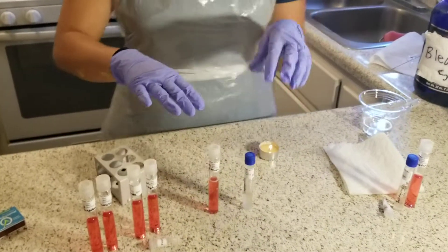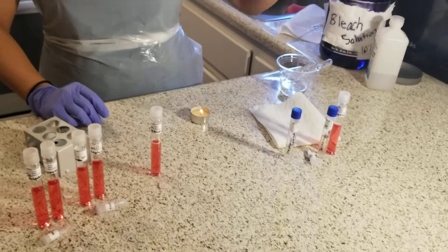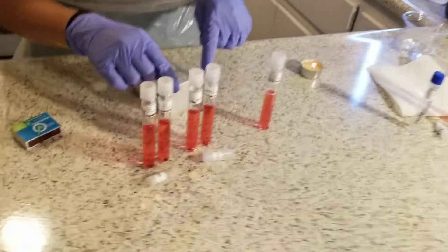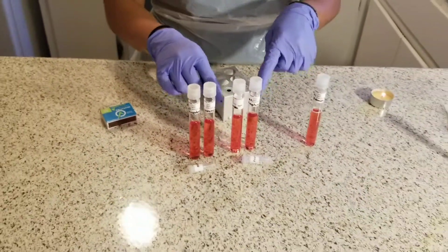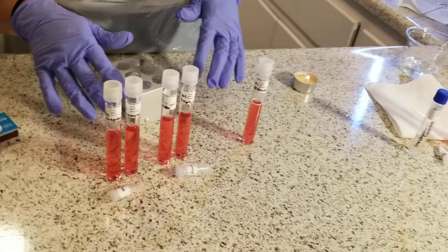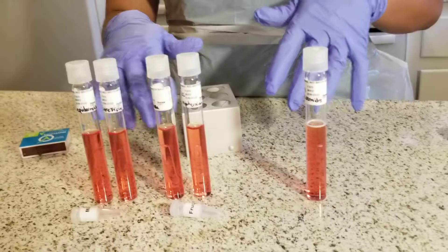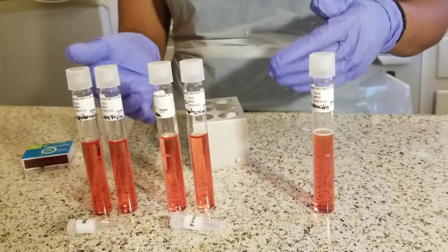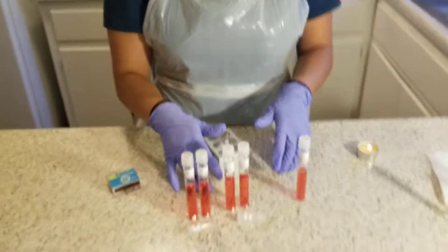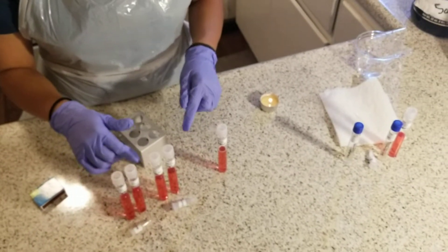With the culture bacteria, I'm going to put them in the refrigerator for future experiments. For the phenol red broths, all have been inoculated. I'm going to go ahead and place them in the incubation location for 12 hours. After the 12 hours, I will observe them for carbohydrate fermentation results. If there's no change after the incubation, I will do an additional six hours. After that, I will observe each broth, noting the color of the solution and the presence of gas bubbles in the Durham tubes.